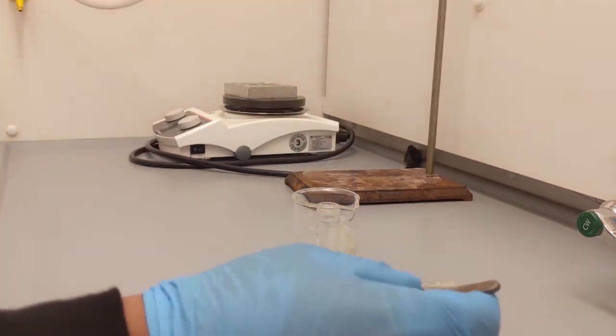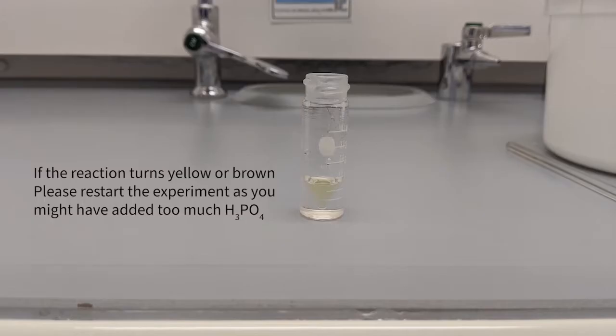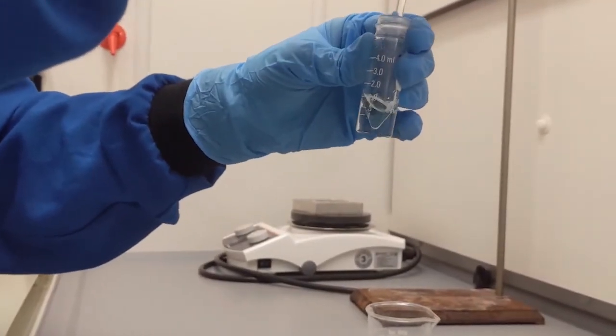The crystallization should begin. If instead of white crystals forming, you see a color change, your reaction may have impurities and may not have occurred like it should have. You may want to start over.